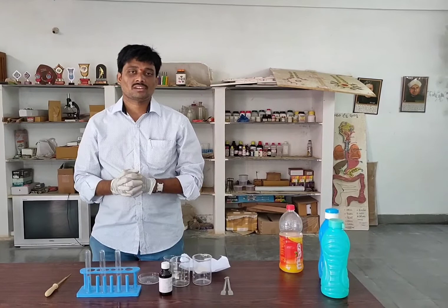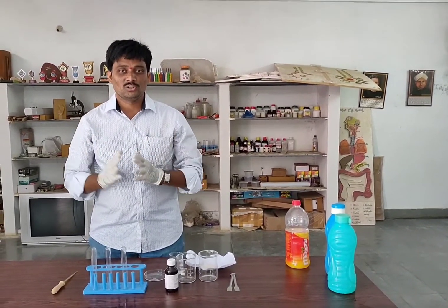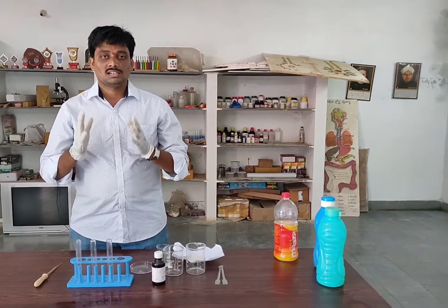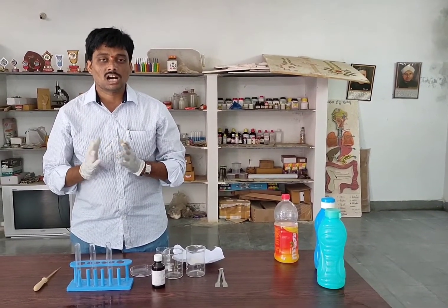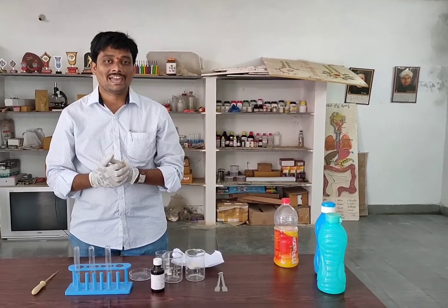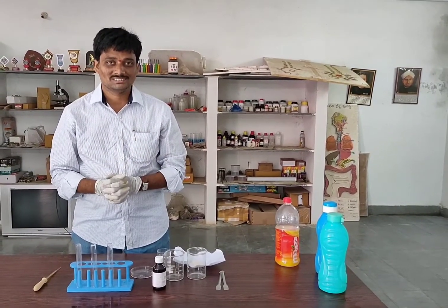Hi everybody, I am Ravish here. Today, in this video, I am going to demonstrate the action of saliva on flour — how our saliva is going to act on flour, today we are going to see.